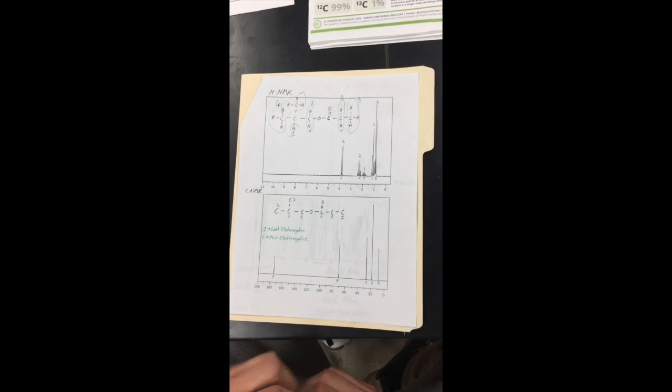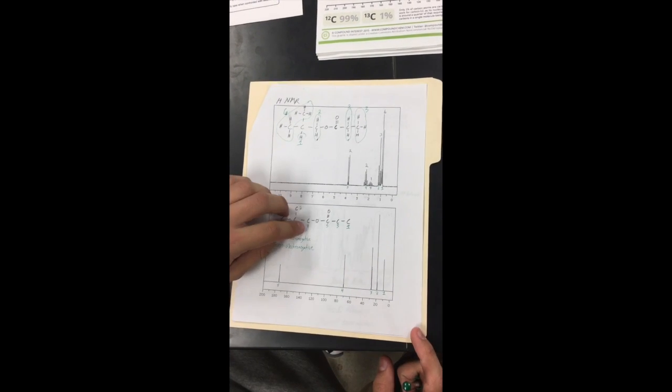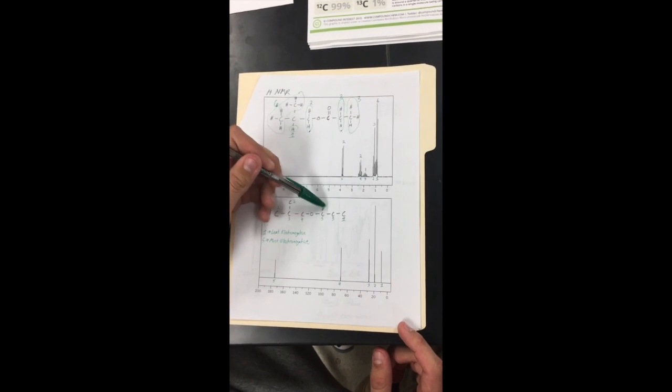4, this one suggested that it could either be an ether or ester, but as we can find out, the next one is an ester, so we thought it would be the next closest to the ester in the molecule, so this 4 right here is that carbon. Lastly, the 5, the ester, right here, taking up this carbon.